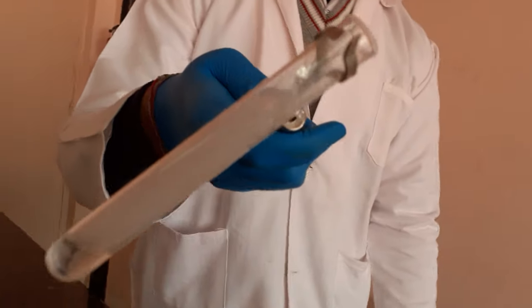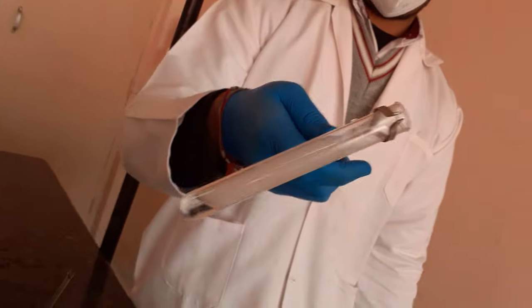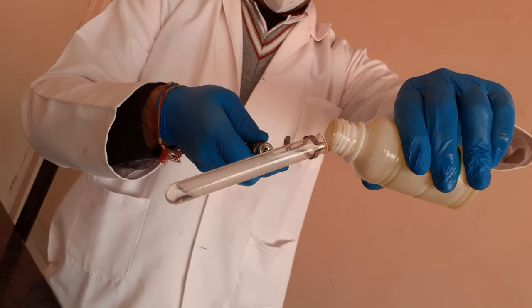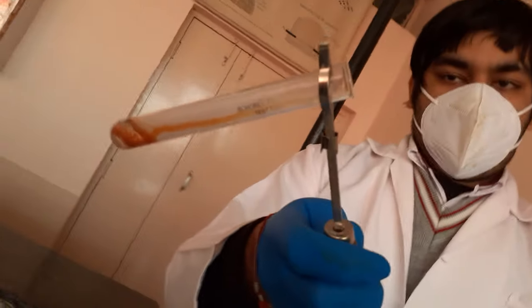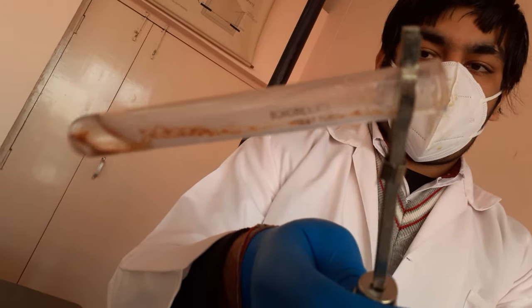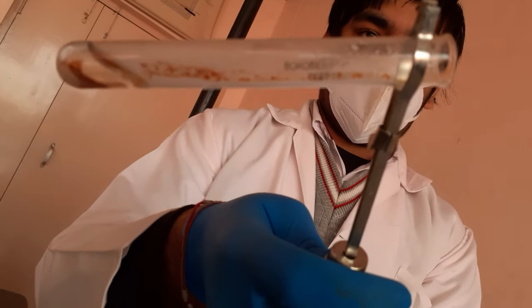These dense white fumes are of ammonia and we can confirm it by adding Nessler's reagent into this test tube. If it turns brown it will confirm that it has ammonium ion in it. Press it a little — the Nessler's reagent. Can you see? You will have to observe the Nessler's reagent on the sides of the test tube, because it reacts with the gas. This brown precipitate formation of Nessler's reagent confirms that we have ammonia gas in the test tube and the ion that we are testing is ammonium.